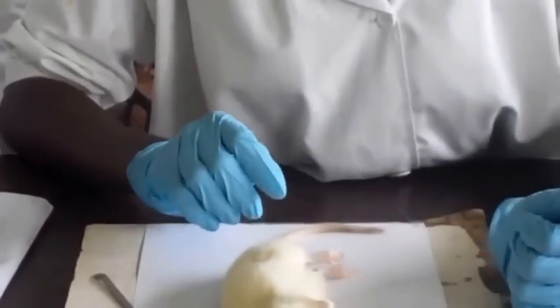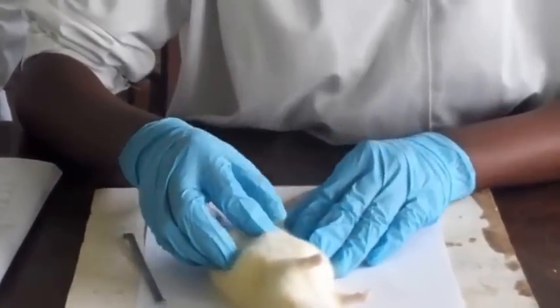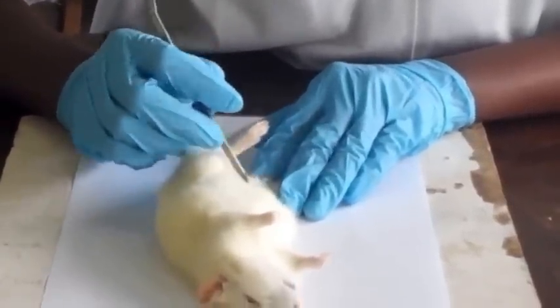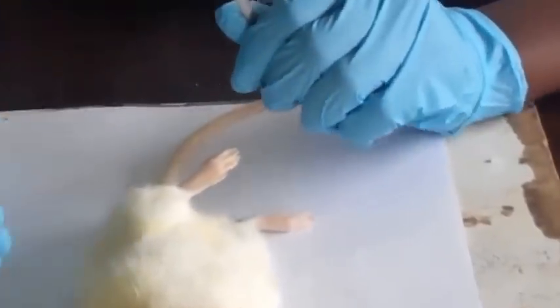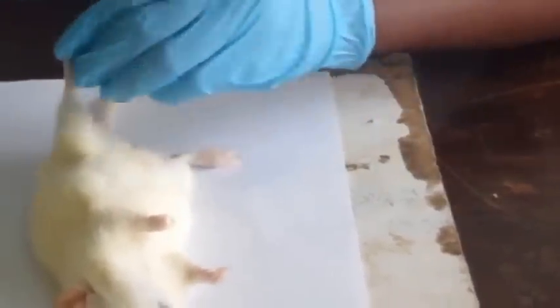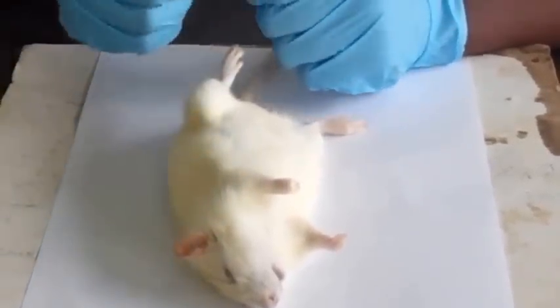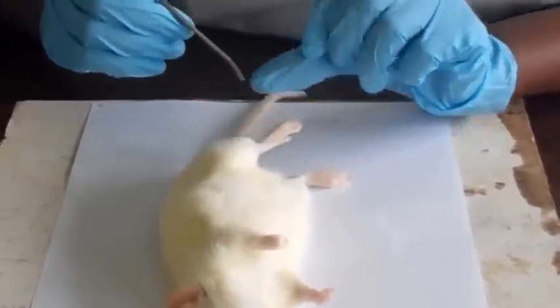It belongs to class Mammalia because this one we have right here is a female rat. So we shall see the mammary glands. Sorry, the nipples. The mammary glands will be seen from inside, but outside we can see the nipples. They're right here. There are 6 of them. And then it has thick fur, these hairs. It possesses external sexual organs. It has 2 external ears. And then it has a 5-digit pattern of limbs, basically of the feet. As we can see, there are 1, 2, 3, 4, and 5.